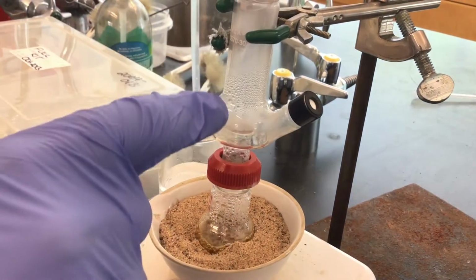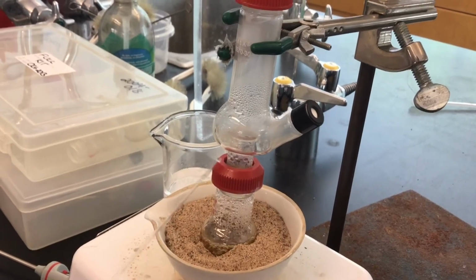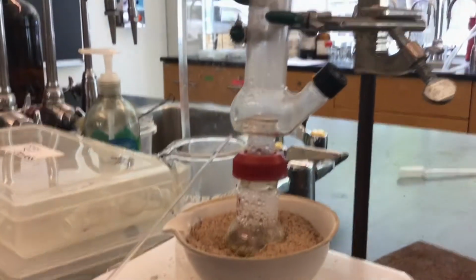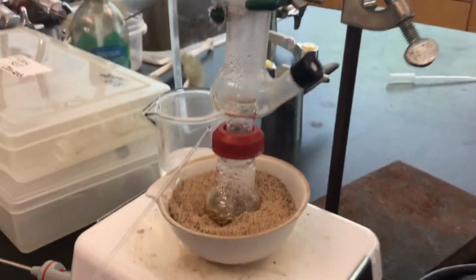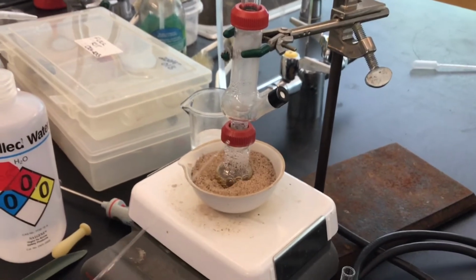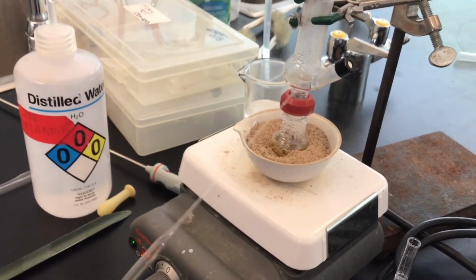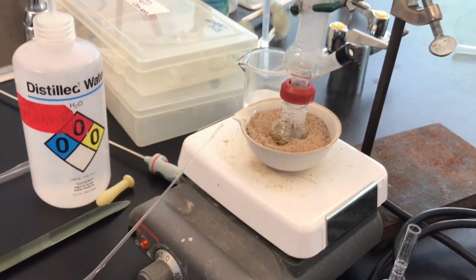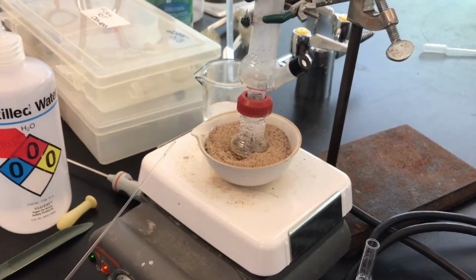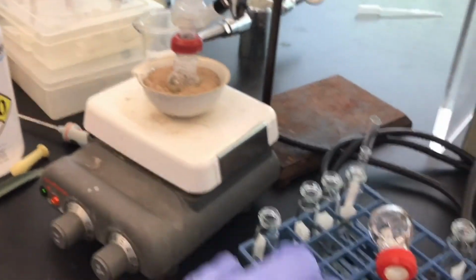This is the steam distillate, so we're waiting for this to condense and then pool in this area here. But this is what we want to see. This means that our distillation is going well, and now all we have to do is be patient. If you are impatient, you might use some foil in order to insulate this, but there's really no need for that.